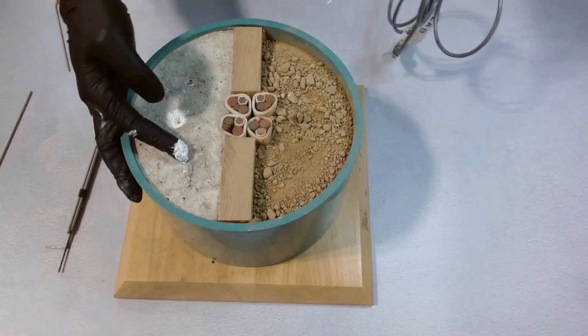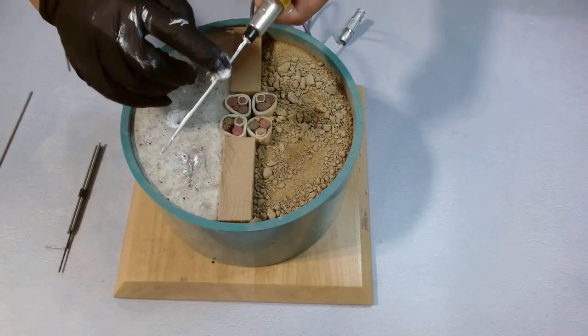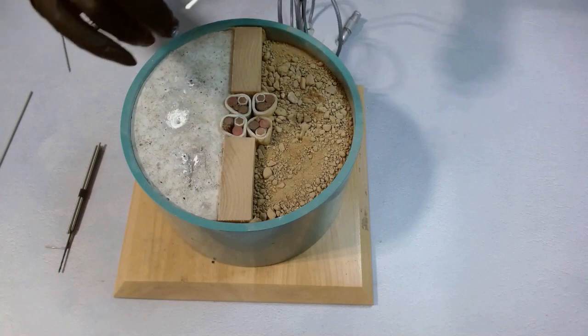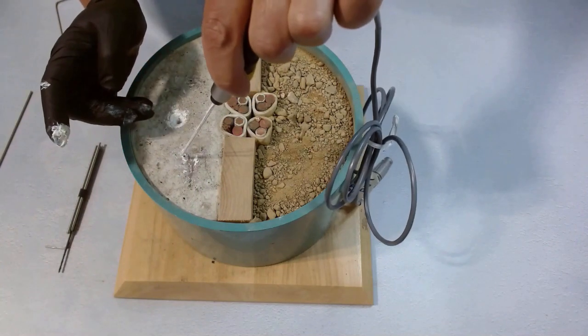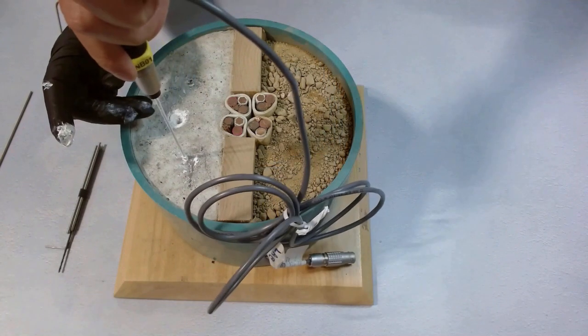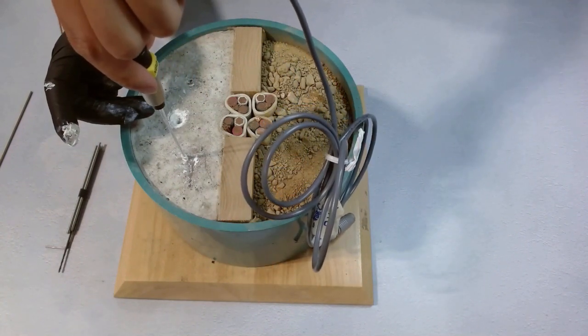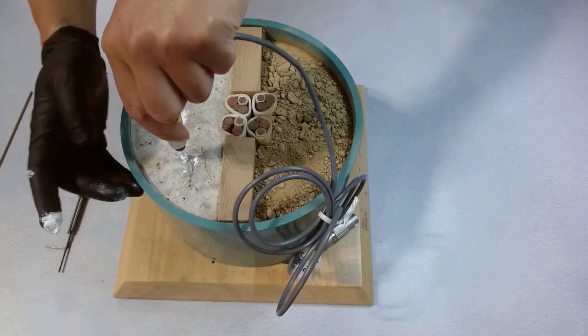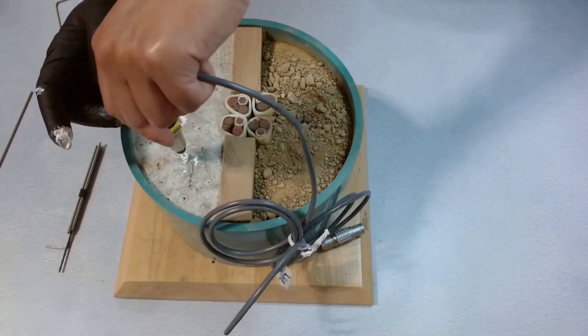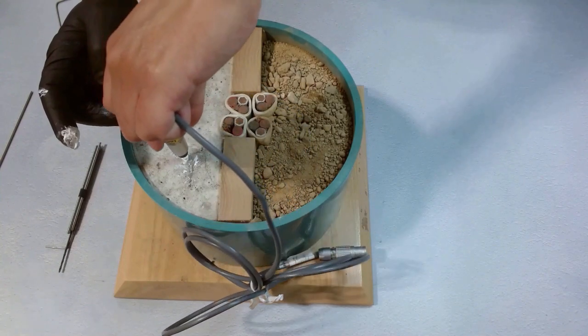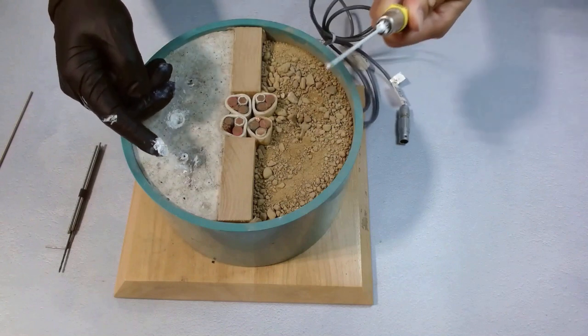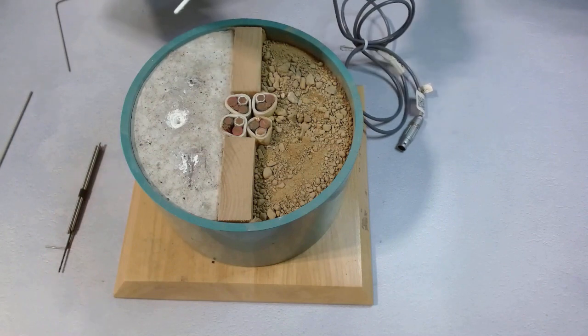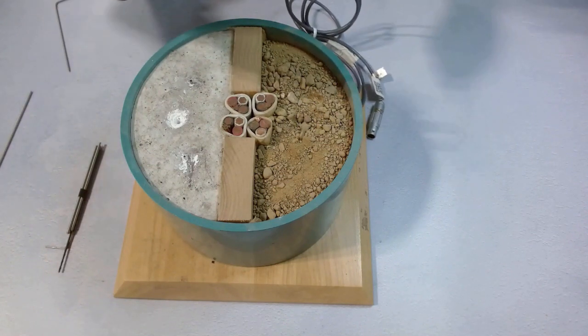Cover the shiny parts again. Make sure all the space in the needle sleeve is filled up with thermal paste. Slowly, in case there's any dry paste left in there. Give a little twist. We can twist when we're pushing it in and out. This time is already much better. Barely see any part exposed. So we add a little bit more thermal paste.